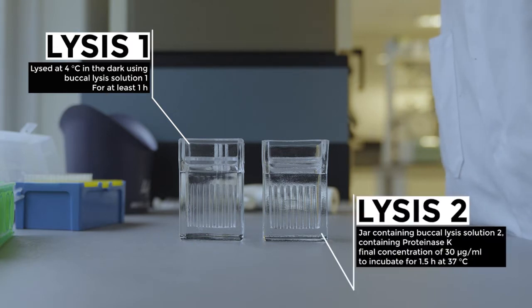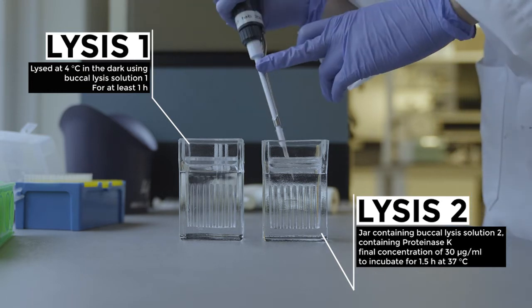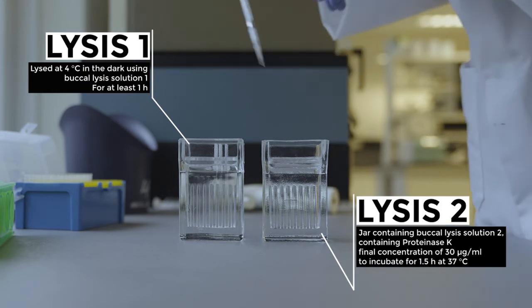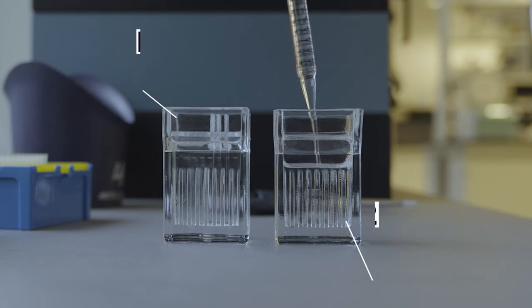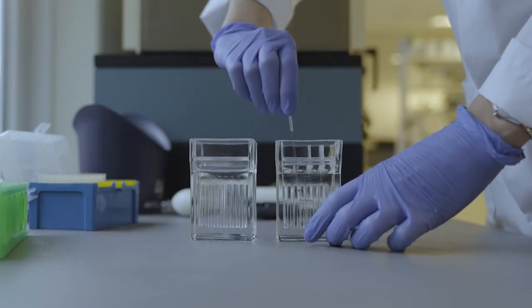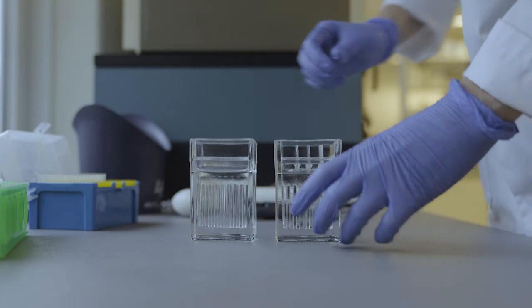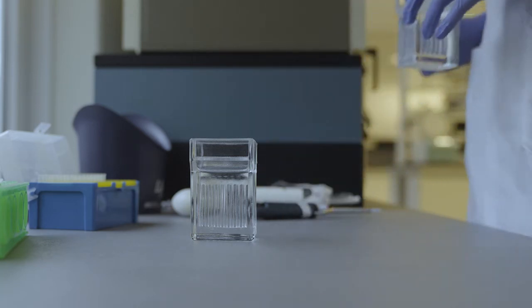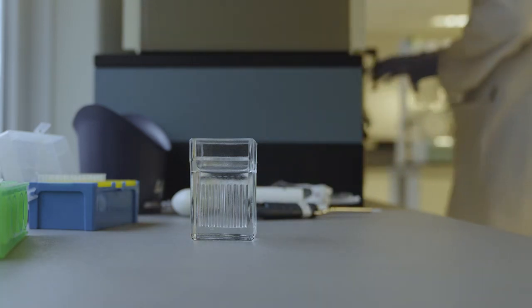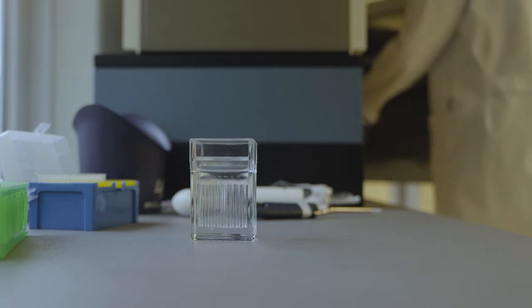After this first lysis step, add proteinase K to the pre-warmed buccal lysis solution 2. Transfer the slides to the second lysis solution and incubate for one and a half hours, maintaining a temperature of 37 degrees Celsius.